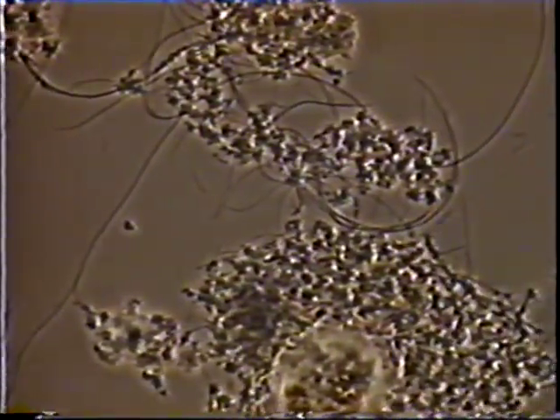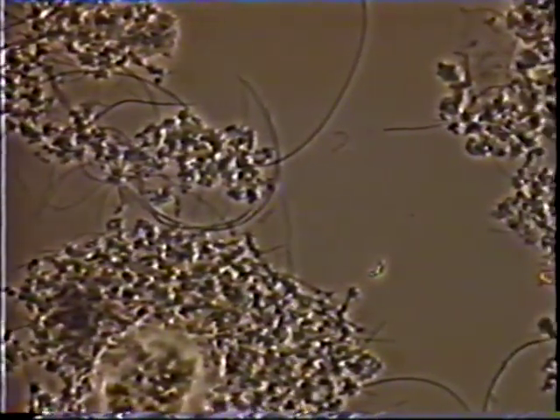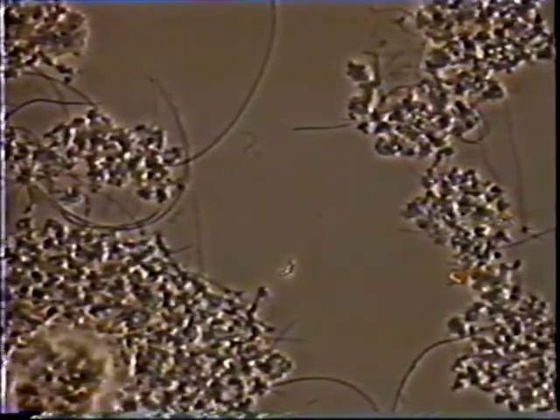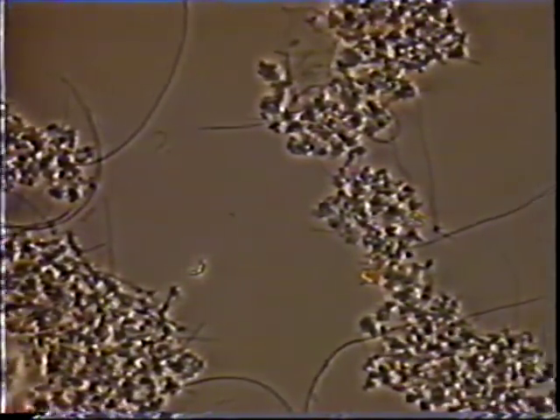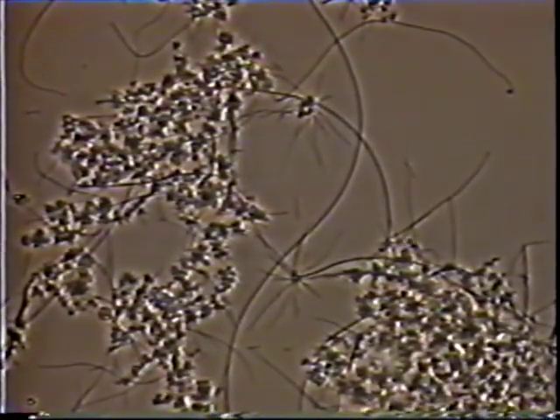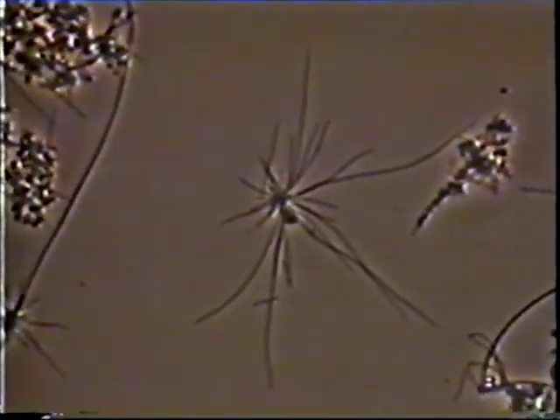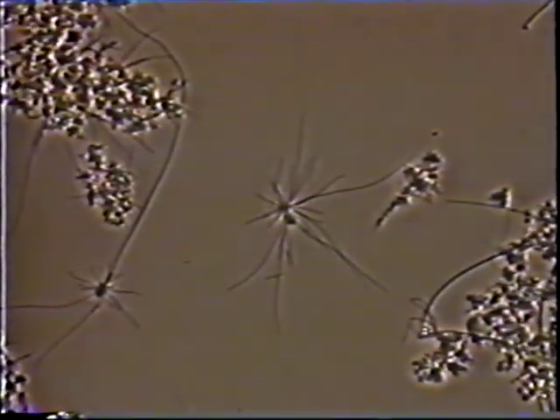Thiothrix cause significant interfloc bridging, shown here at 100 power. There are 2 Thiothrix species present here, the thinner type 2 and the thicker type 1. It has a distinctive structure called a rosette. Here, filaments grow out of a common floc, resembling a starfish. This is a key characteristic for identifying Thiothrix.